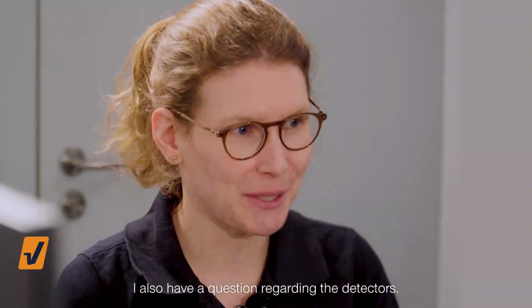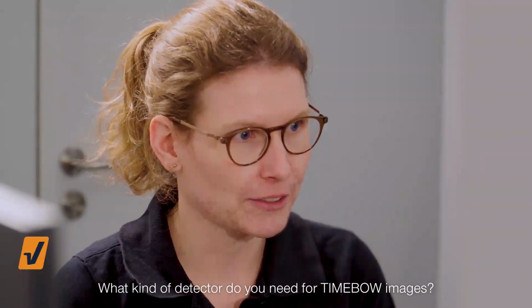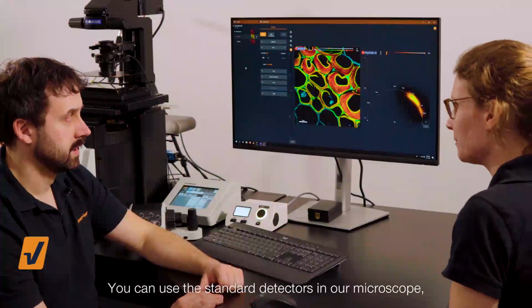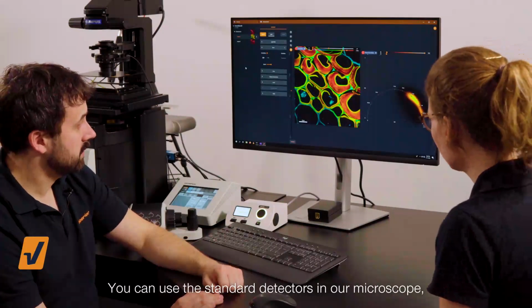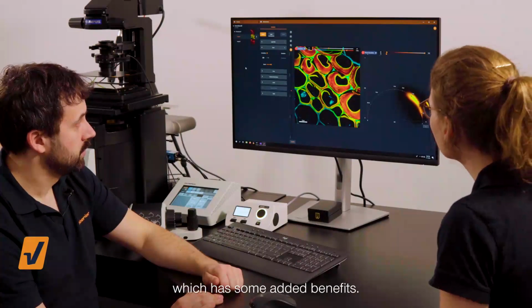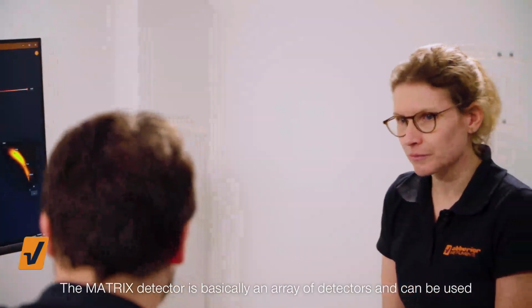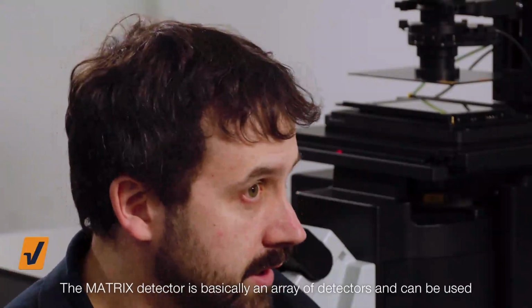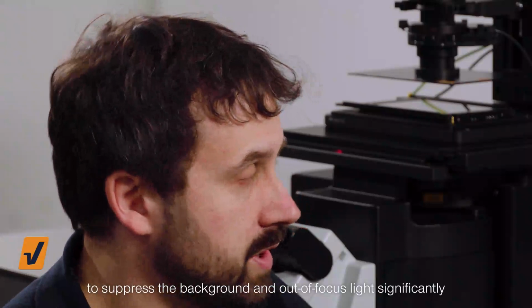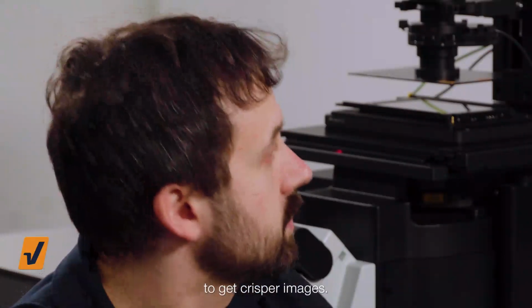When you're talking about the microscope, I also have a question regarding the detectors. What kind of detector do you need for the TIMEBOW images? You can use the standard detectors in our microscope, or you can switch to the matrix detector, which has some added benefits. And the matrix detector is basically an array of detectors and can be used to suppress the background and out-of-focus light significantly to get crisper images.